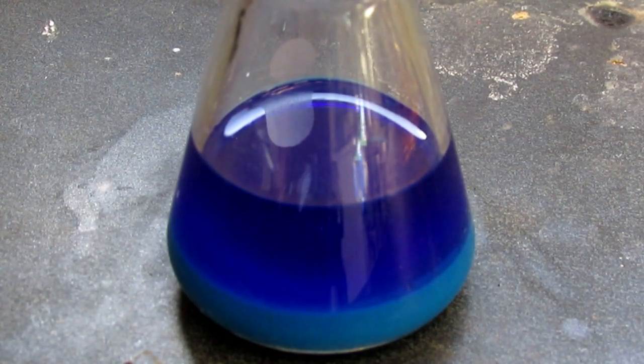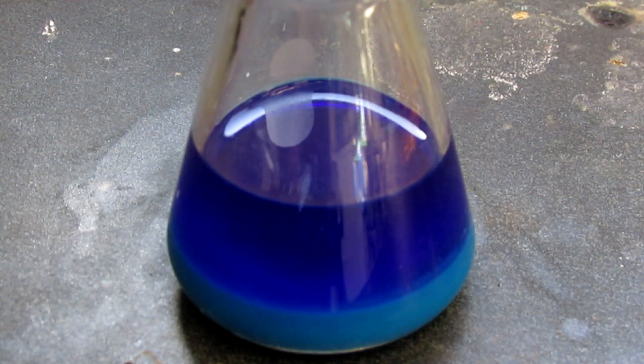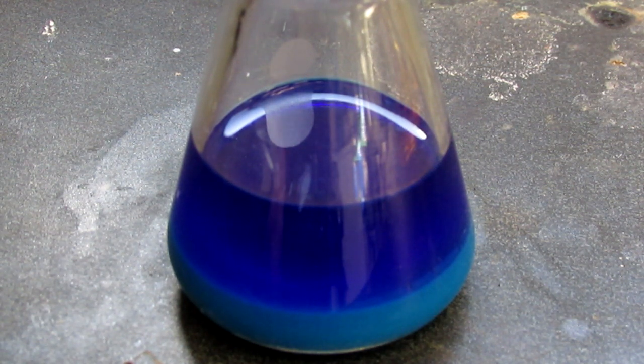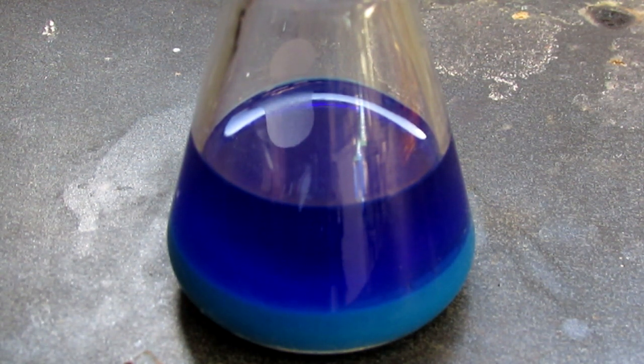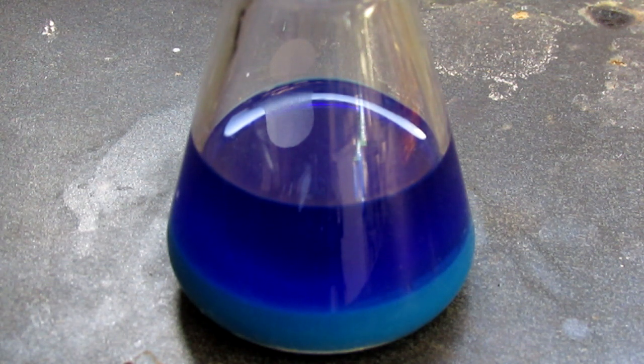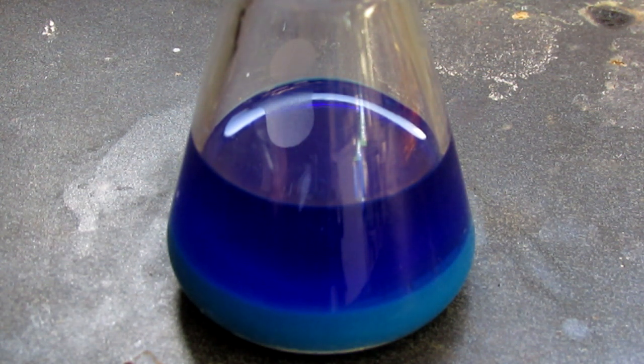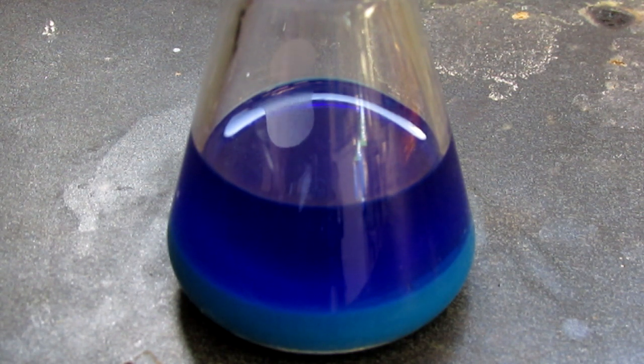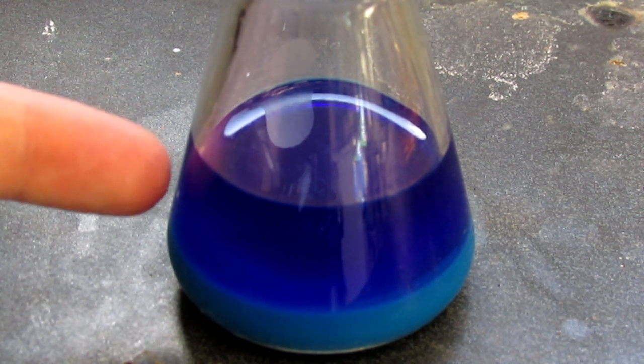I've taken it off heating and I'm going to let it cool down to room temperature before filtering it. You can see it's a very nice blue color - it's actually a lot darker blue in person. The camera kind of washes it out, almost a more purple color, but the precipitate is definitely very blue though. This solution up here is more purple.